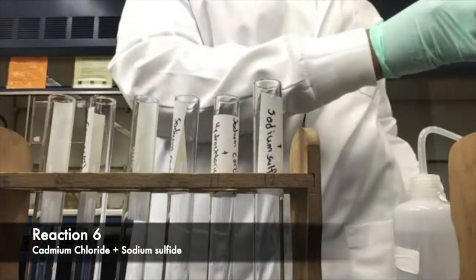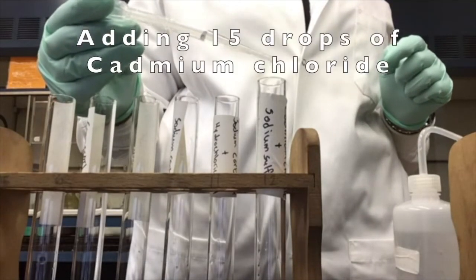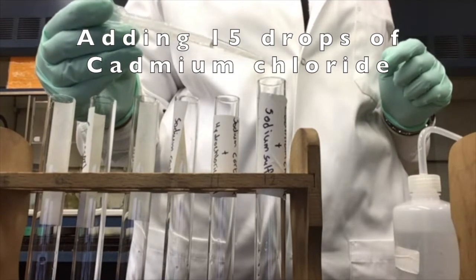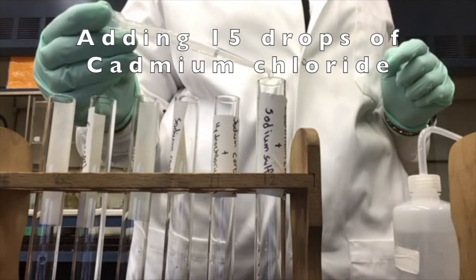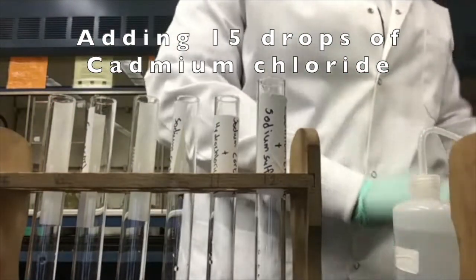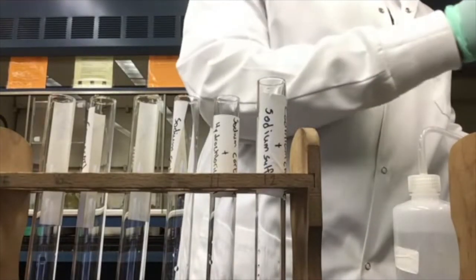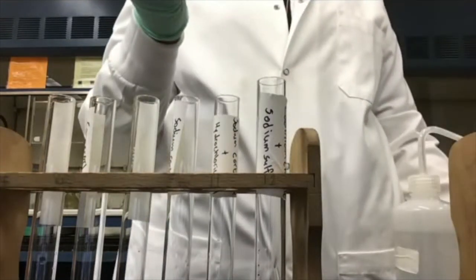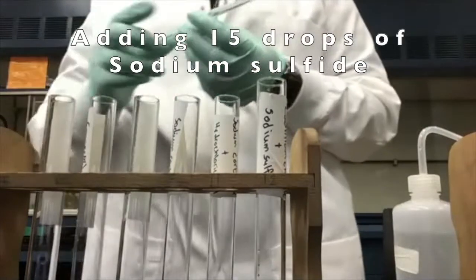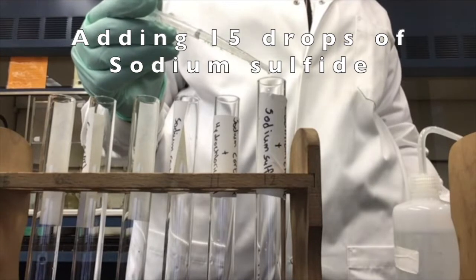For reaction 6, we have cadmium chloride and sodium sulfide. First, we're going to add 15 drops of cadmium chloride to our 6th test tube. Having added our 15 drops of cadmium chloride, we'll now add 15 drops of sodium sulfide.